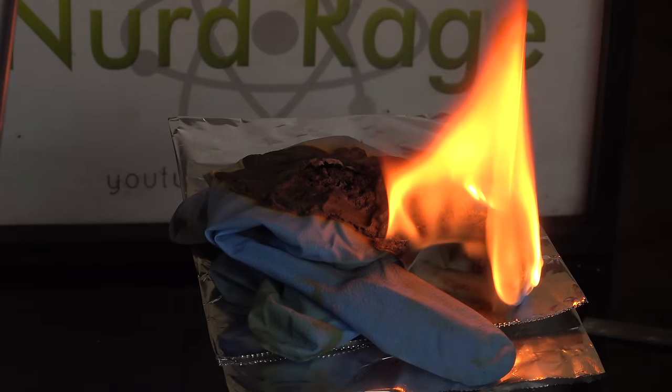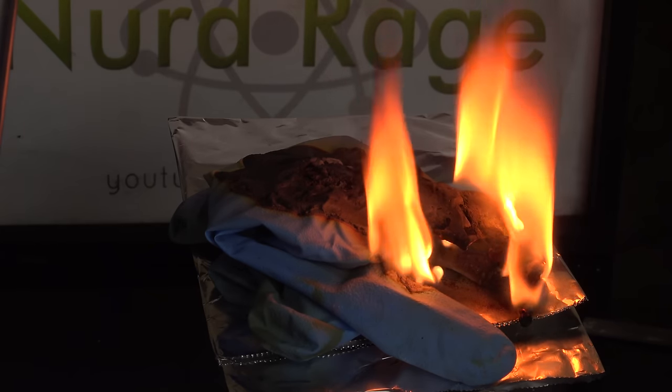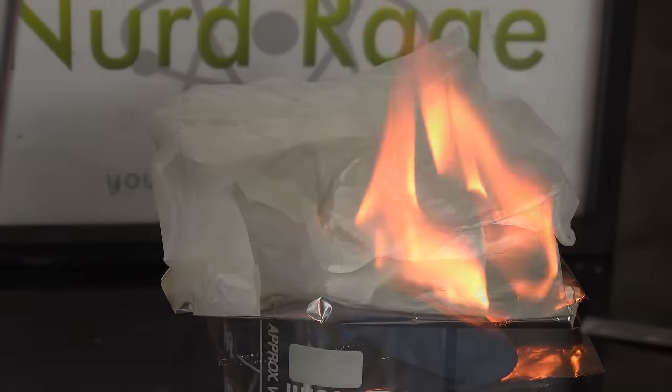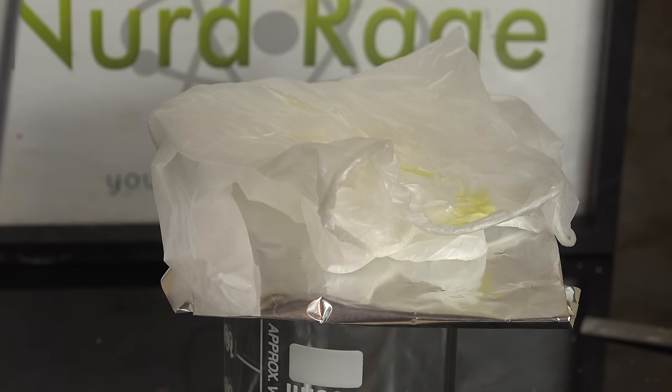Maybe I'm being overly dramatic but you do need to have a bucket of water or sink nearby to toss the gloves in before they ignite and lead to another lab accident. So what if you do want to use fuming nitric acid? Is there any way to protect your hands or do you have to go barehanded and hope your skill is enough? Actually, vinyl gloves are reasonably resistant to fuming nitric acid while also being inexpensive and easy to buy. Here is a vinyl glove and I'm now dripping on fuming nitric acid. It is reacting and slowly soaking through, but similar to nitrile gloves it's not immune — it will buy you some time to take them off. Unlike nitrile gloves though, it's much more resistant and most importantly does not catch fire. So in future videos I'll be using vinyl gloves when working with fuming nitric acid and avoiding nitrile gloves.